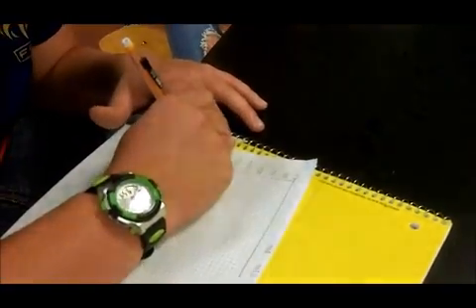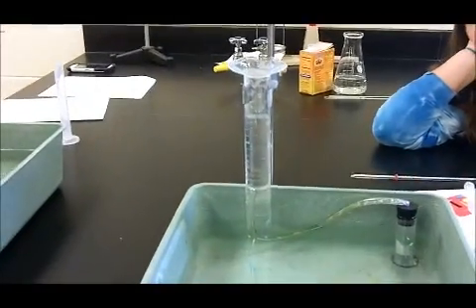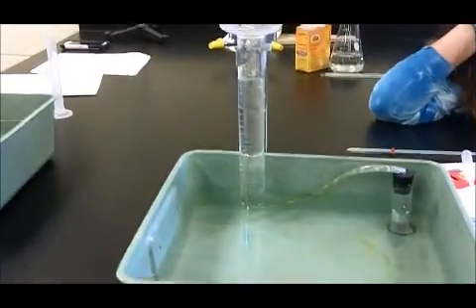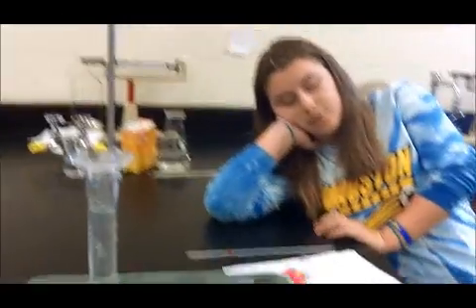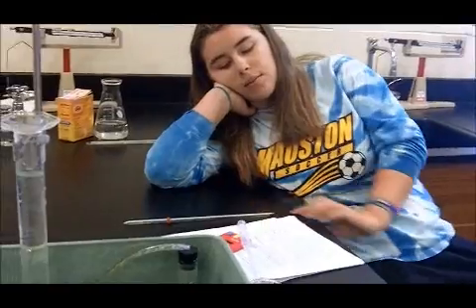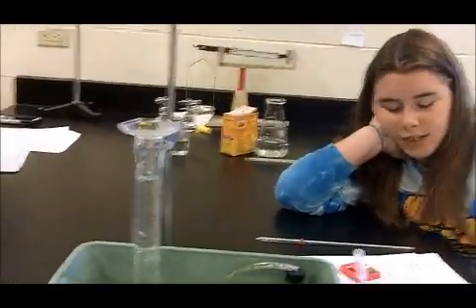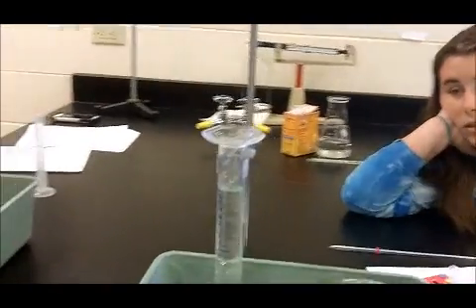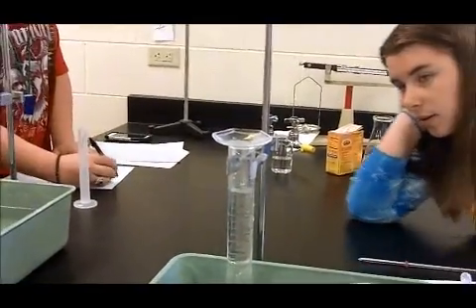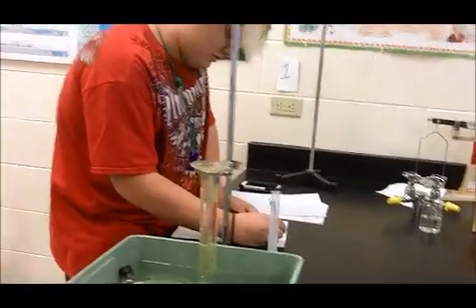The teacher asks what the students have in their setup. They explain it's 10 milliliters of hydrogen peroxide and 0.75 of the catalase. The teacher confirms this is 0.75 of the catalase, noting it should be running a little slower — and indeed it kind of is.